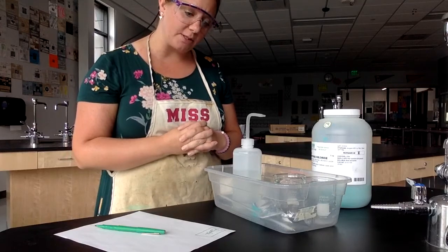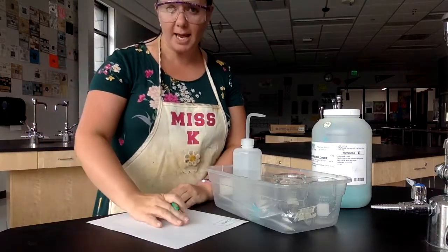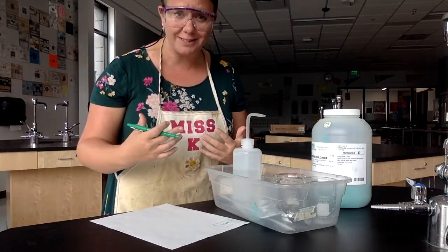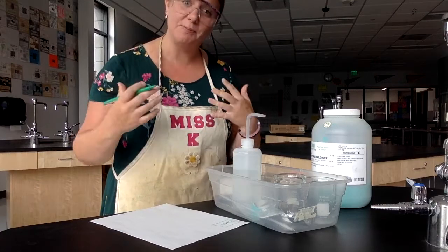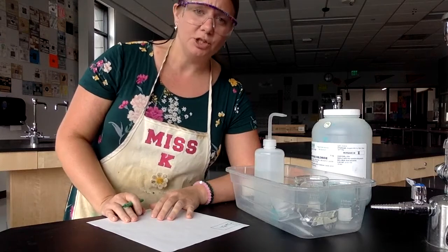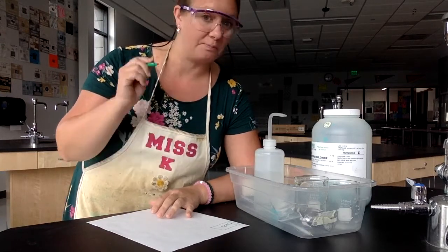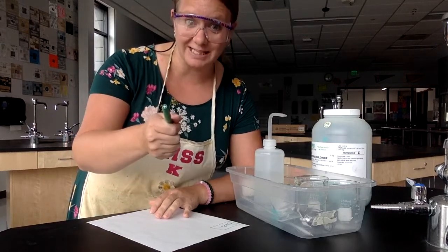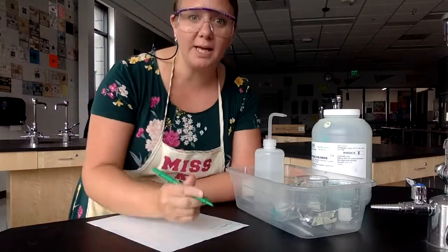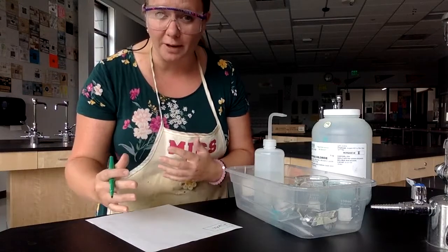The purpose of this lab is to show the difference between physical and chemical changes, and we need to take some data. I'm going to ask you to set up your data table. You have the procedure on your lab sheet, so hopefully you looked ahead and thought about that. If you don't have your data table set up, pause the video right now and set it up. It's important to have a place in the data table for before and after.